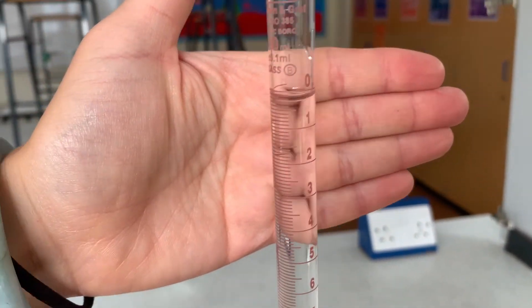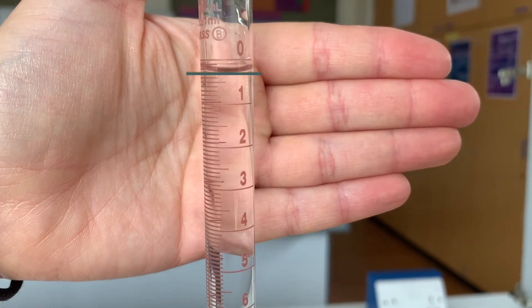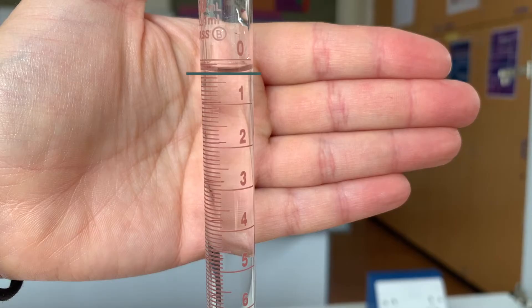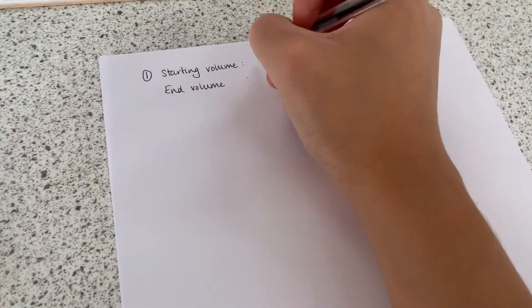Remember you need to read from the bottom of the meniscus. You should give a burette reading to two decimal places, where the second decimal place is either a zero or a five depending on whether the meniscus is on a graduation or between two graduations. I'm reading this as being on the 0.3 graduation, so the reading would be 0.30 centimetres cubed.